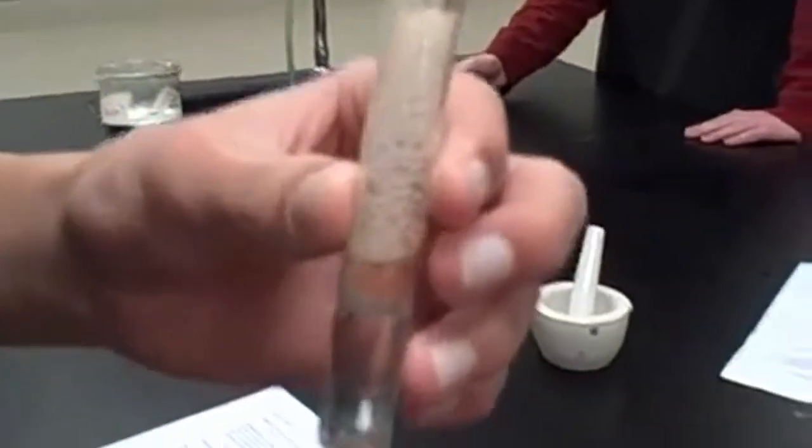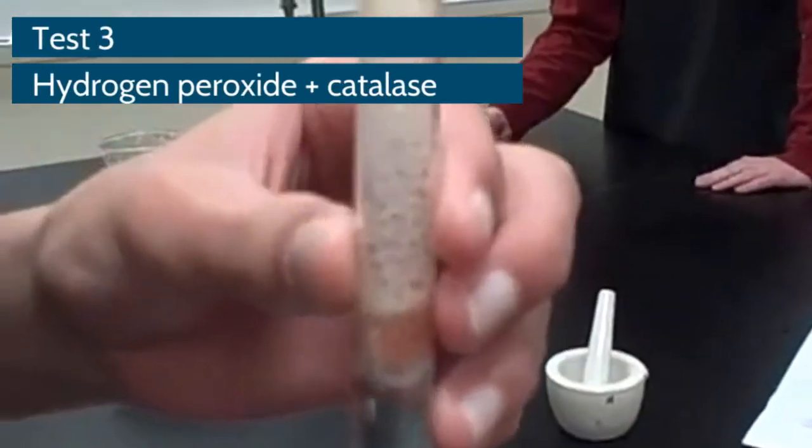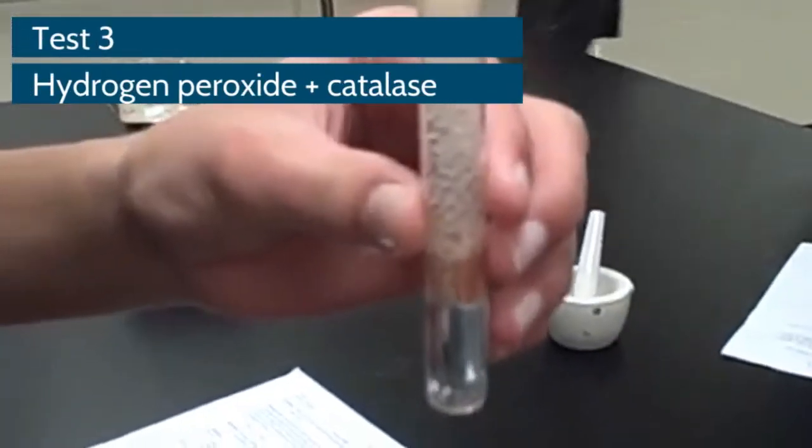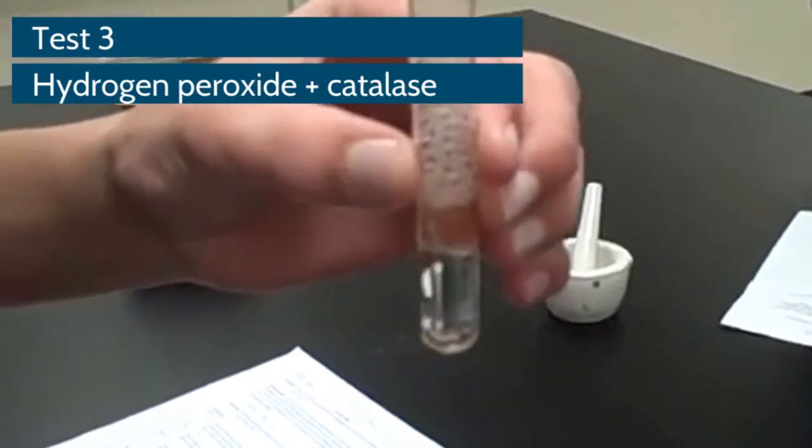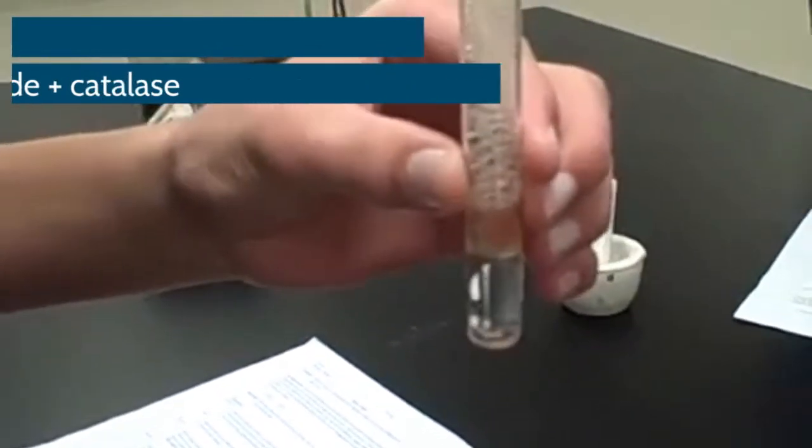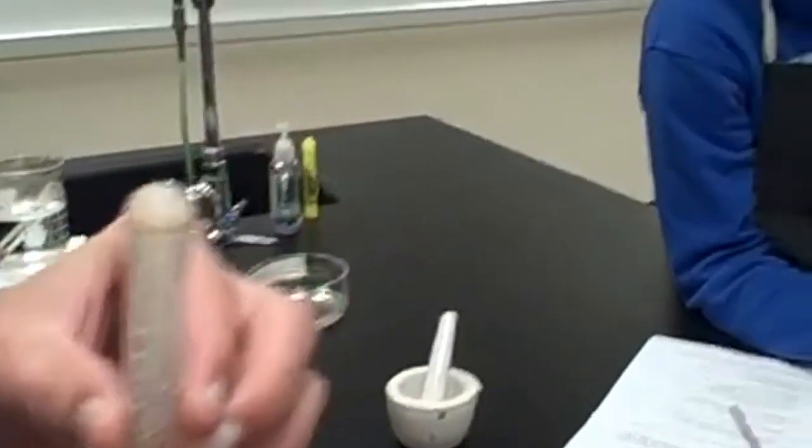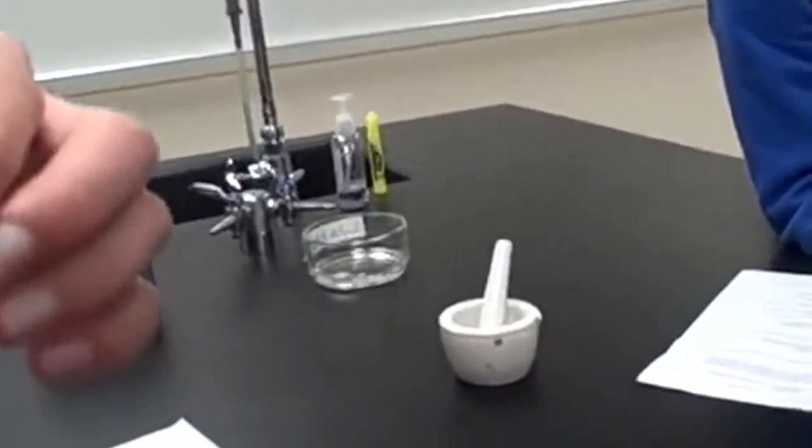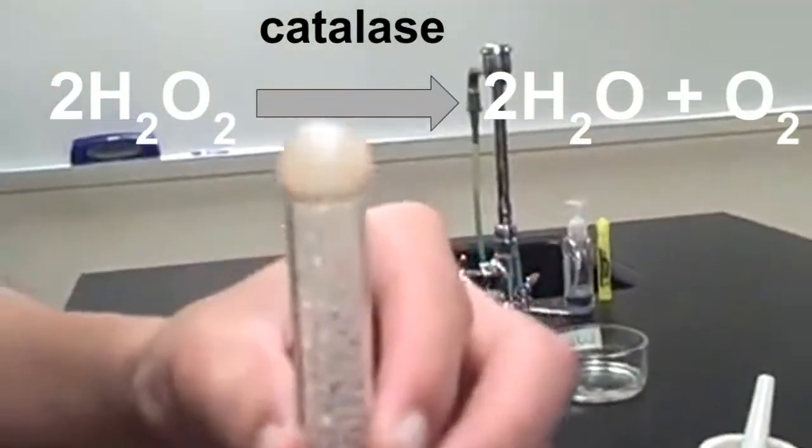All right, what are we looking at in this tube, Andrew? Liver and H2O2. Liver and H2O2. Okay. And Simone, you almost ready with that? Let's get a good flame going. Okay, now go ahead and blow it out. Okay, and let's get through there.